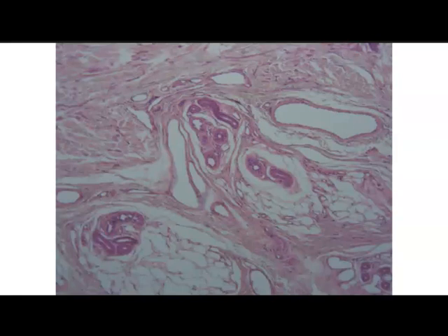So here we can see some adipose tissue, and then we see some dense irregular connective tissue. This slide also shows a vein here. We can see a vein with its very thin layers compared to arteries, which we'll see in the next slide. But we can definitely see our dense connective tissue represented in the slide, specifically dense irregular connective tissue.